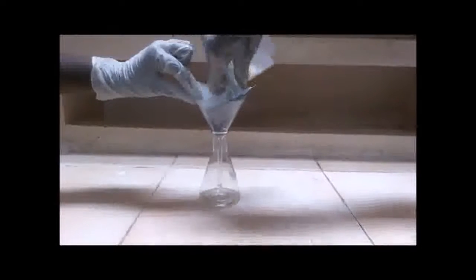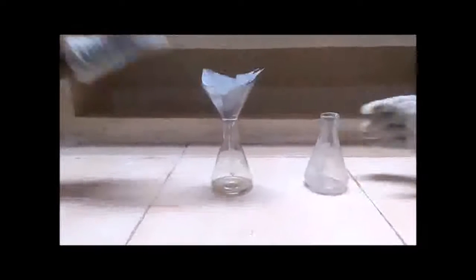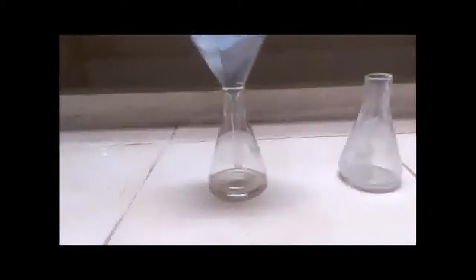Add the reactant mixture onto the filter paper. Wait until the reactant mixture gets filtered and a white slurry is found on top of the filter paper. Take some of the white slurry and add it into a clean conical flask.